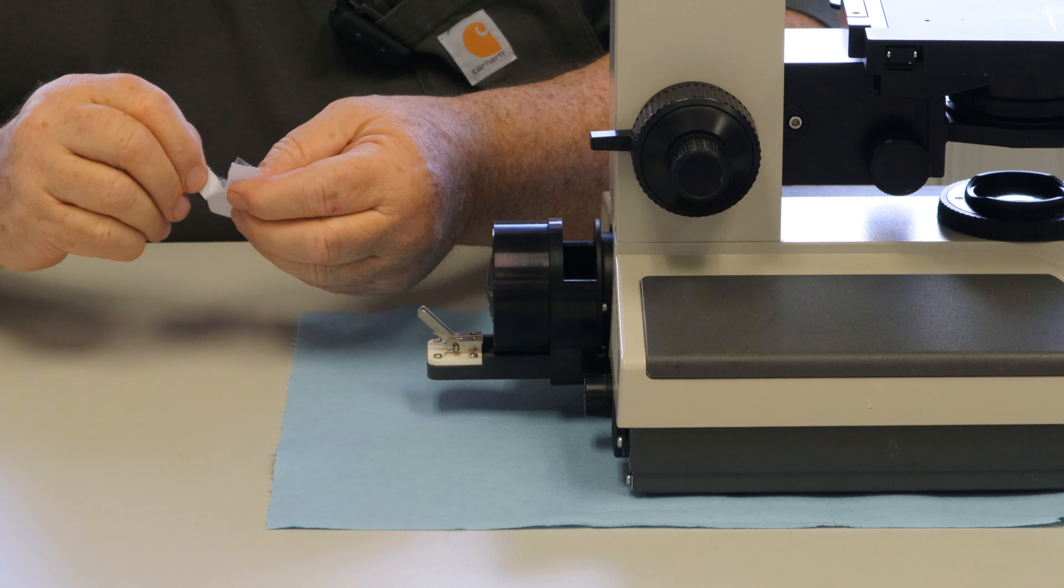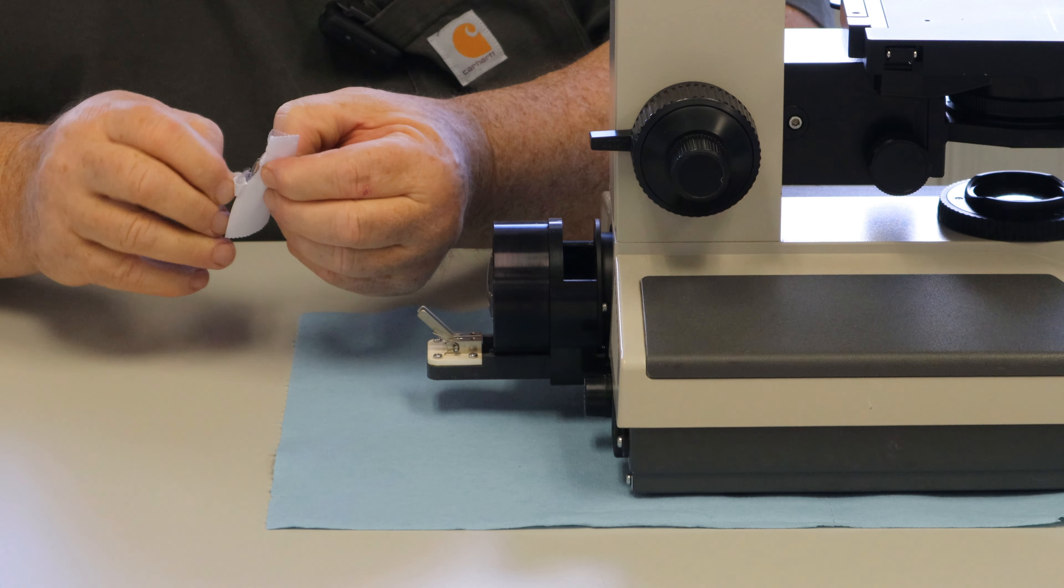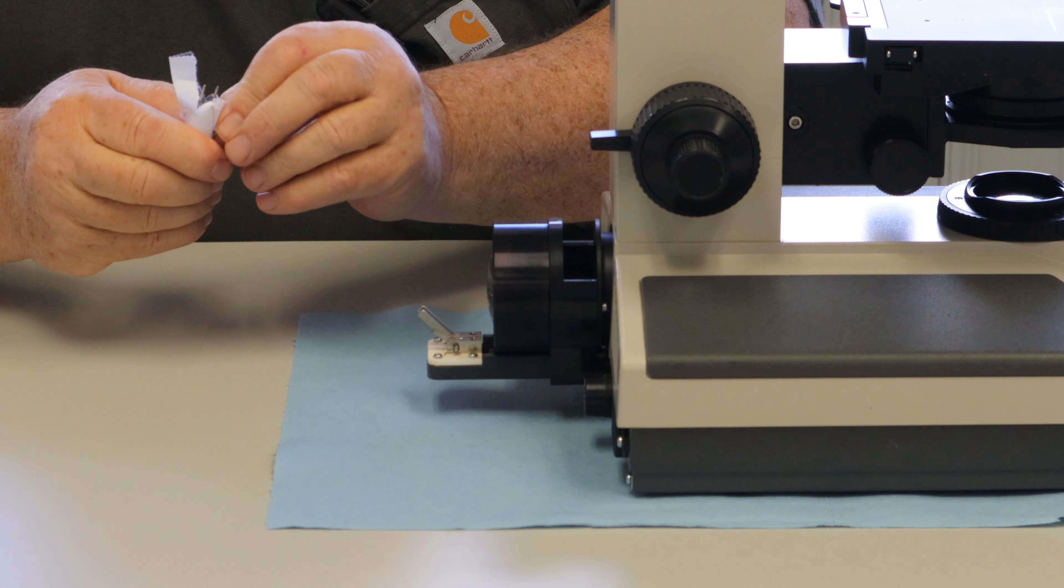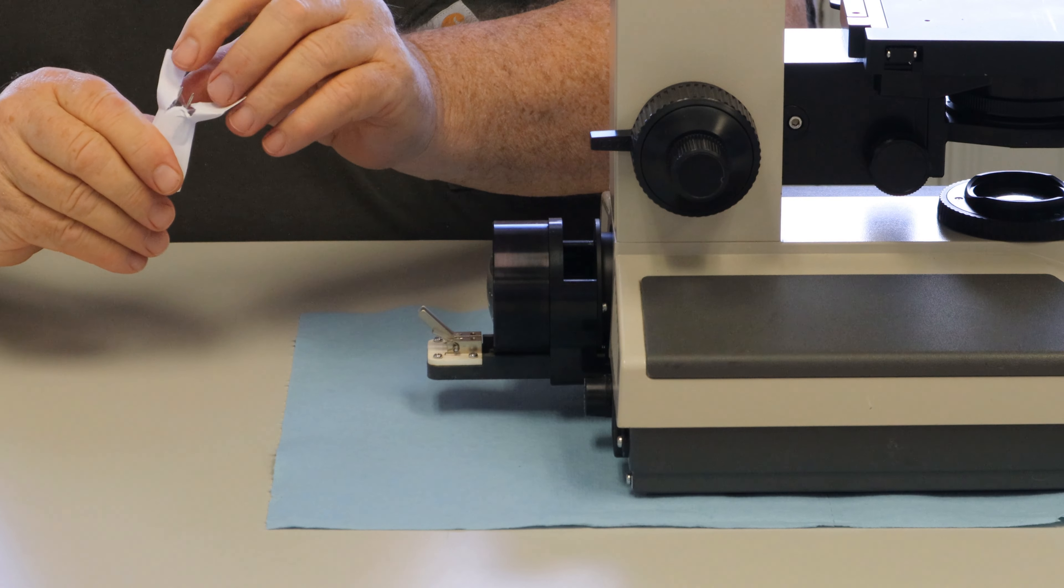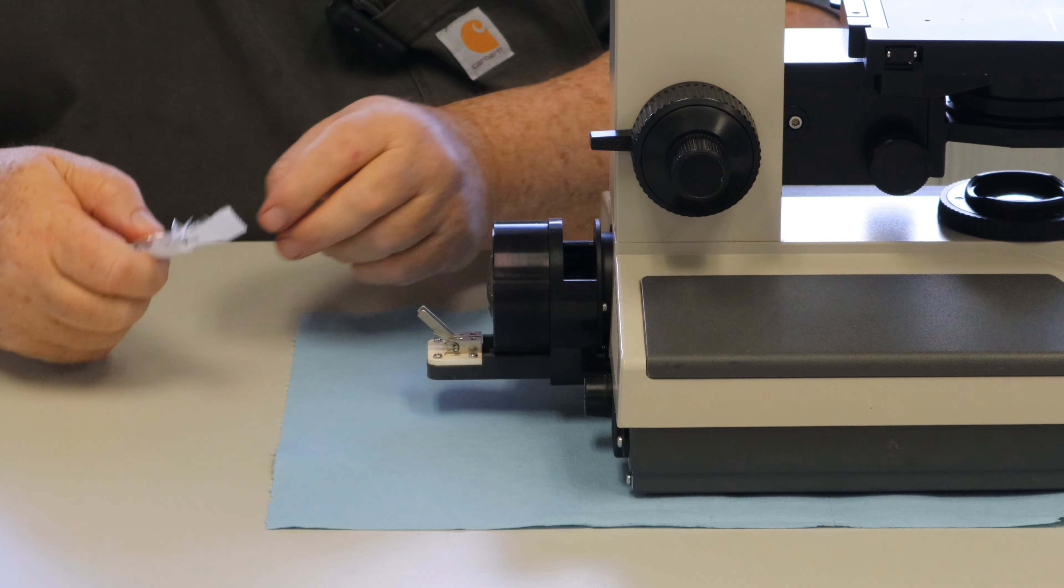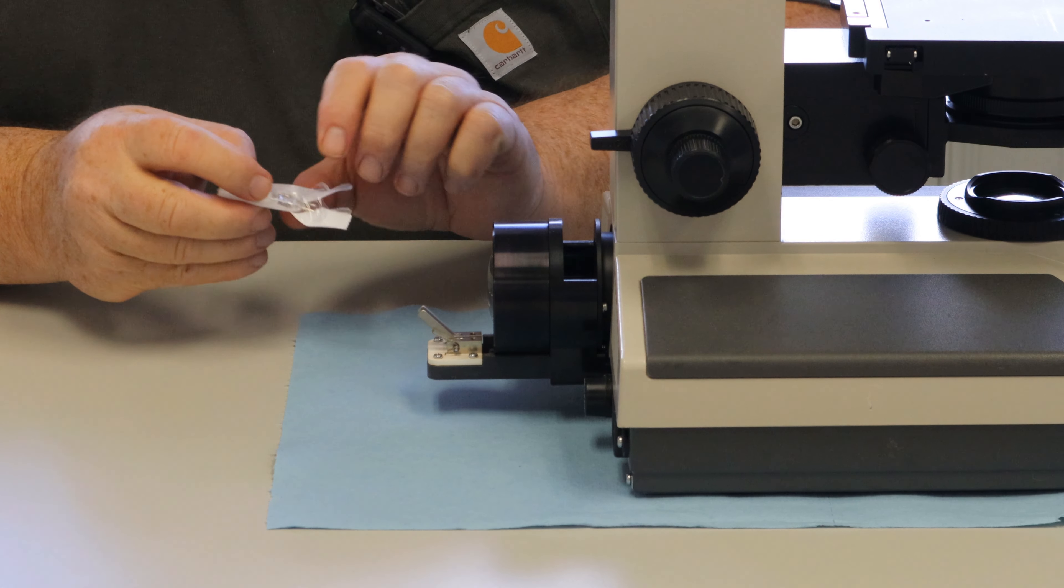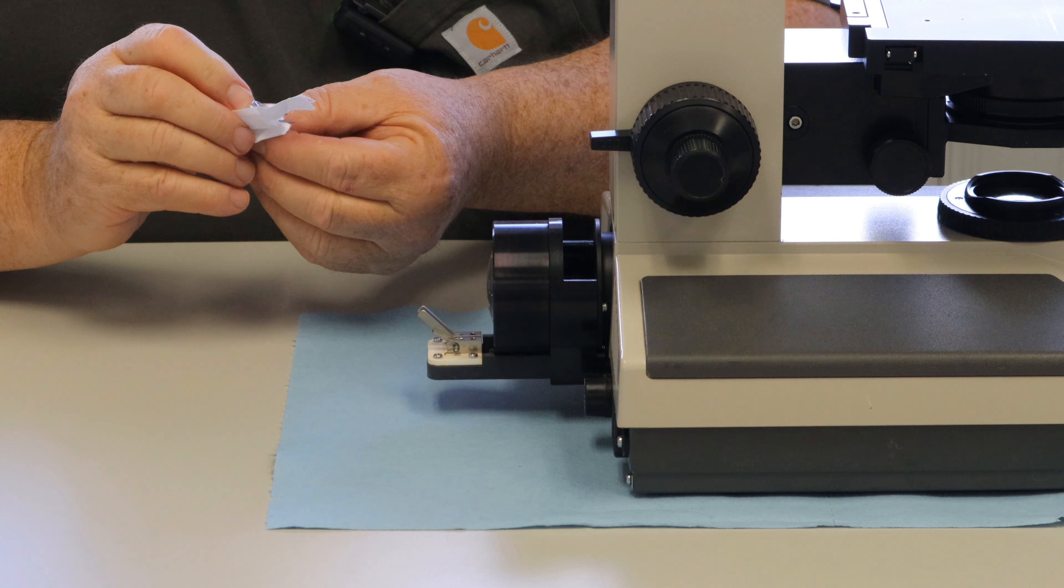Again if you open it up, like so, you can expose the prongs on the lamp bulb without touching the globe. Again the globe, we do not want to get fingerprints on it.